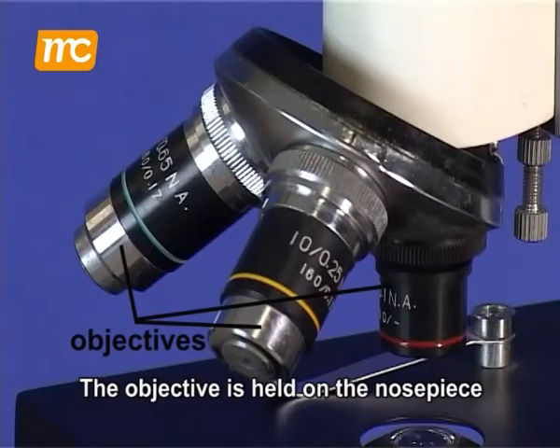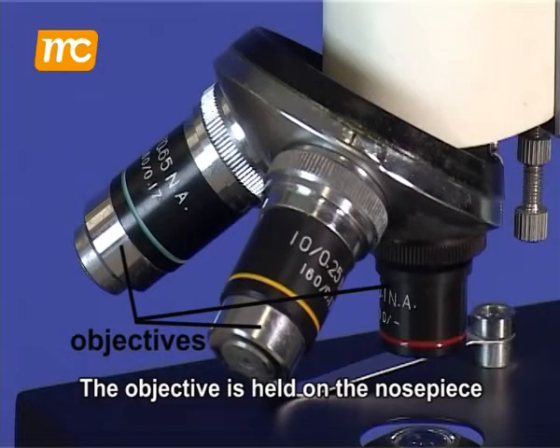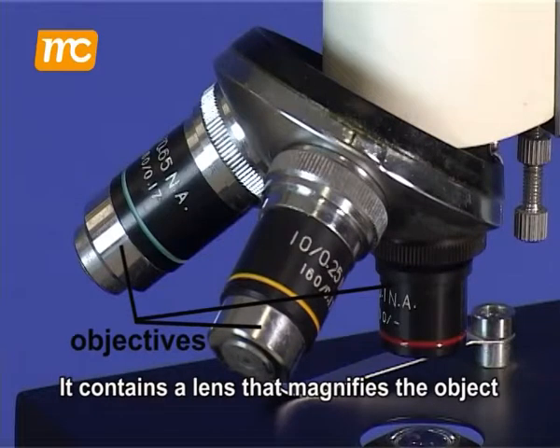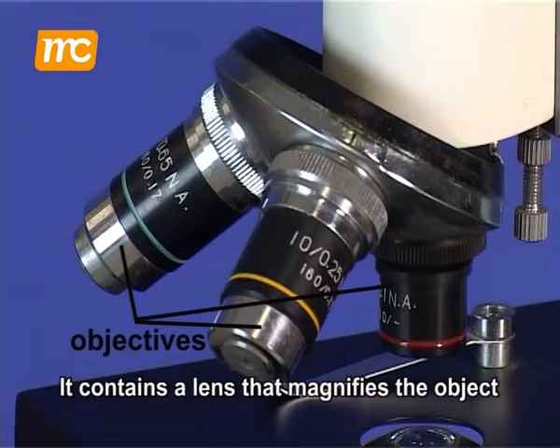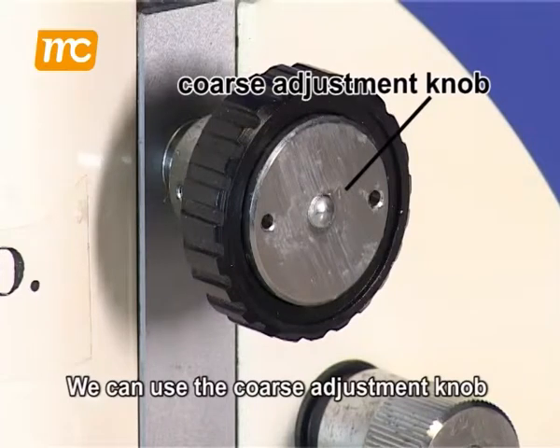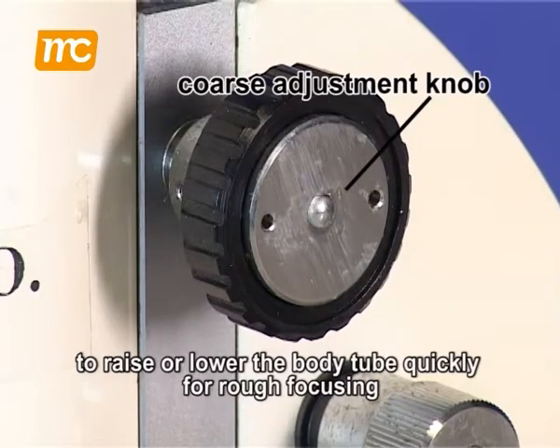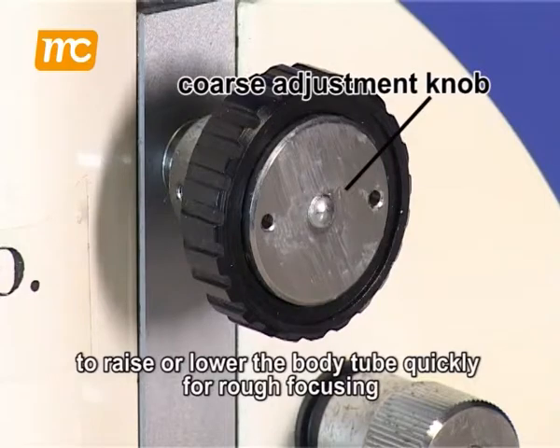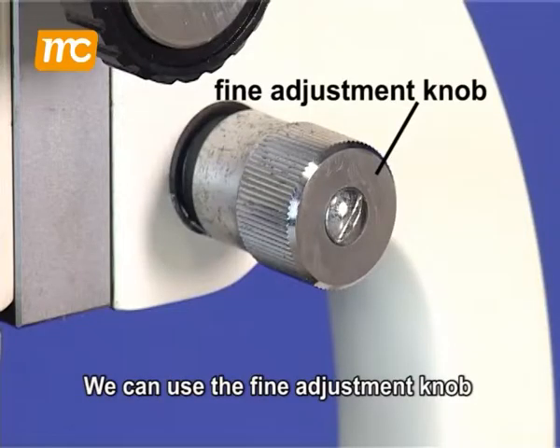The objective is held on the nosepiece. It contains a lens that magnifies the object. We can use the coarse adjustment knob to raise or lower the body tube quickly for rough focusing.